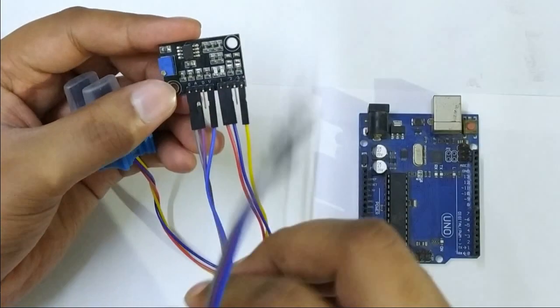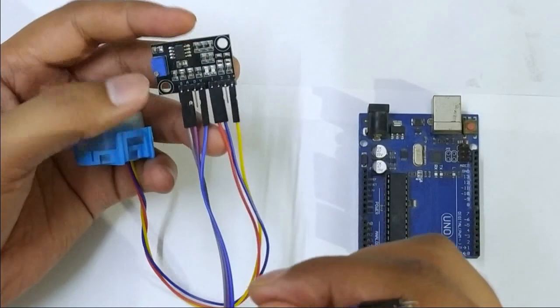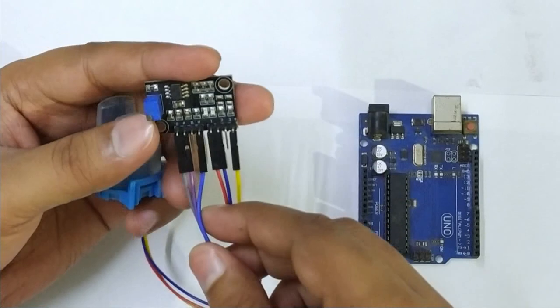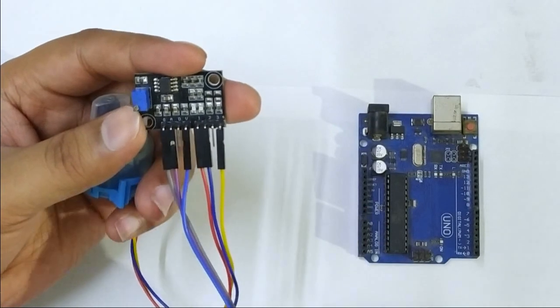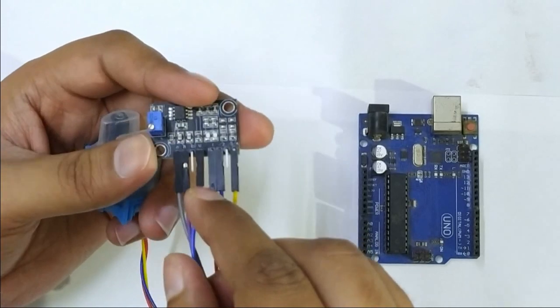And here we have given three pins and three wires to connect to the Arduino, so that we can extract the signal generated from the turbidity sensor. As you can see, there are three wires connected to the V, A and G ports, because we are going to use the analog pin here. A is the analog signal, G is the ground and V is the potential at the VCC.